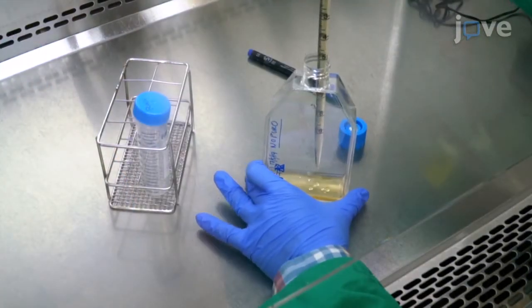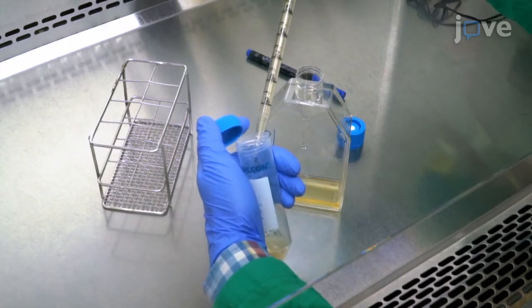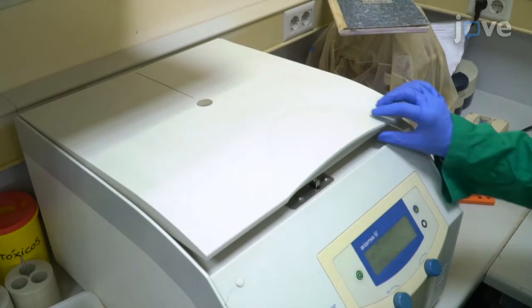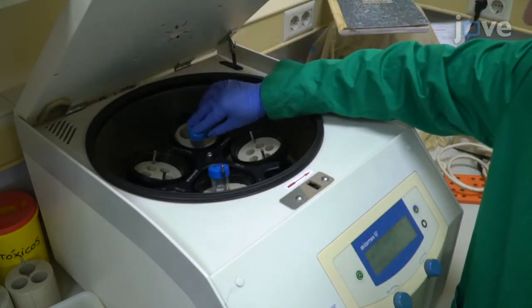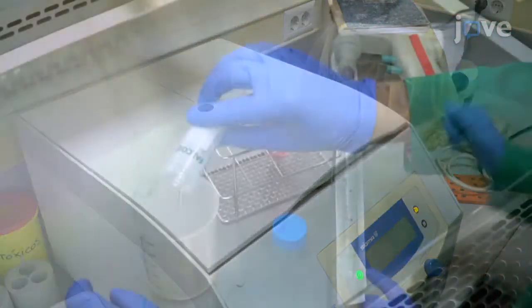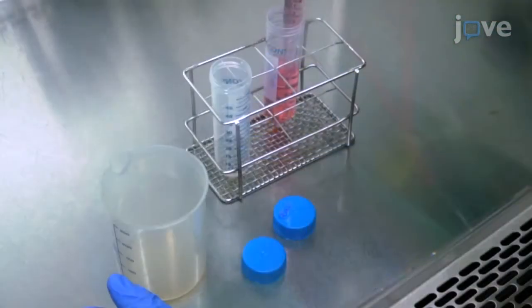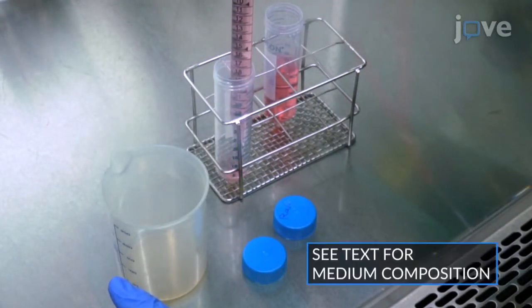Transfer 10 milliliters of a confluent pre-culture of Raji cells to a 15 milliliter V-bottom tube. Centrifuge at 300 times G and at room temperature for 5 minutes. Discard the supernatant and gently resuspend the cell pellet in warm complete medium at a concentration of 1 million cells per milliliter.